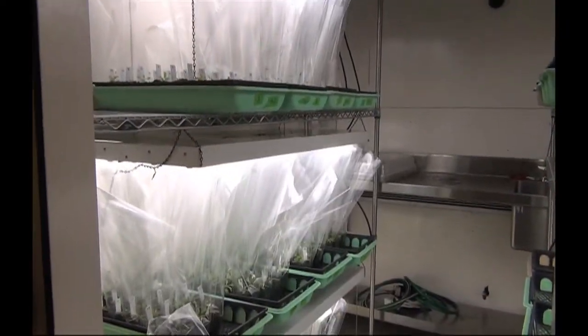The tapered bottom end of the sleeve is large enough so that the bottom of the pot goes through, but small enough so that it fits snugly around the top of the pot. Occasionally, these bags cause excess moisture to get trapped with the plant and mold may grow. Your lab may choose not to use these plastic sleeves.